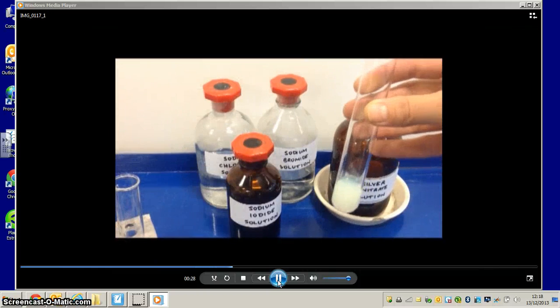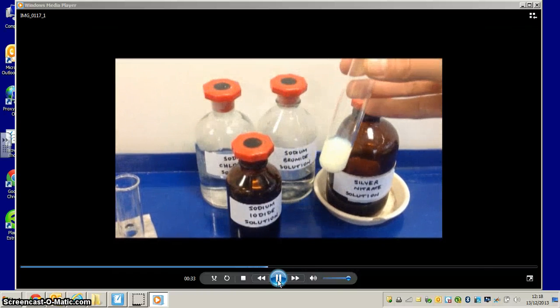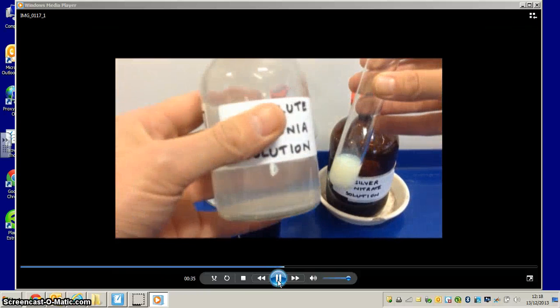When we add the silver nitrate, you will see that the precipitate has a far more yellow appearance.